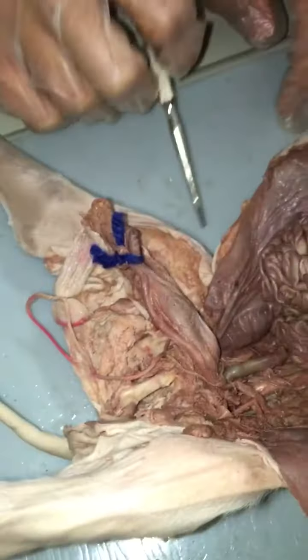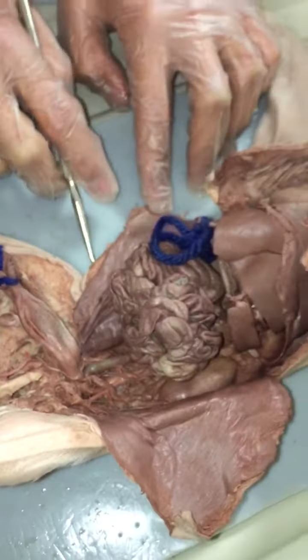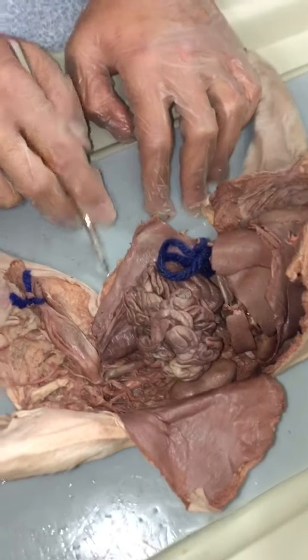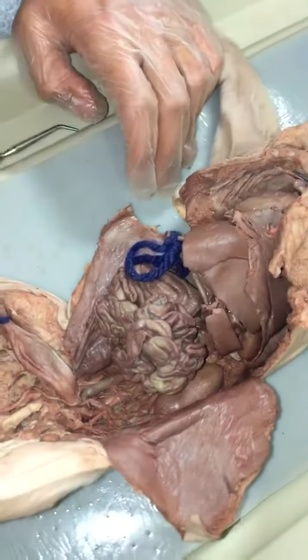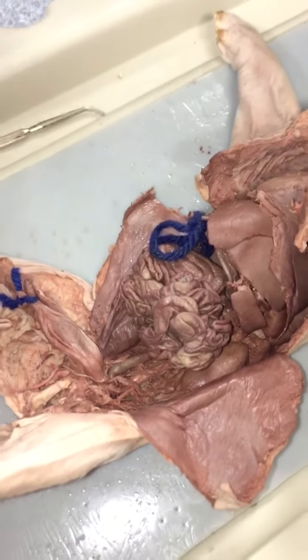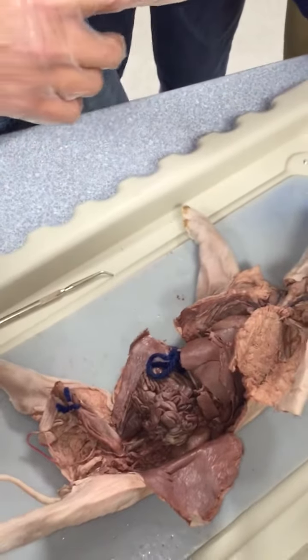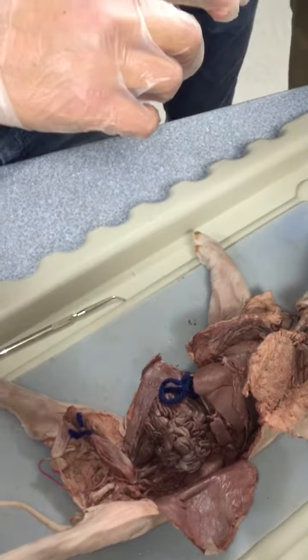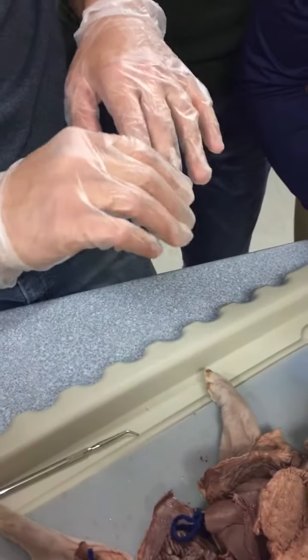Okay. There's two more. Ductus venosus. That's another concept, but let's see. It's kind of inside the liver. So the portal vein is coming from the liver, and then you have the umbilical vein, and they come together into the inferior vena cava. Right where that junction is, between the umbilical cord and the inferior vena cava, there's the ductus venosus.